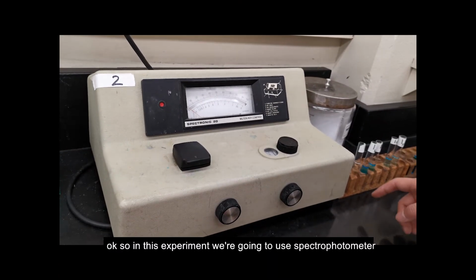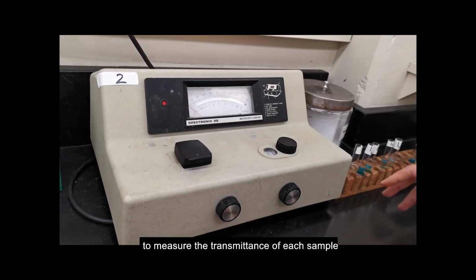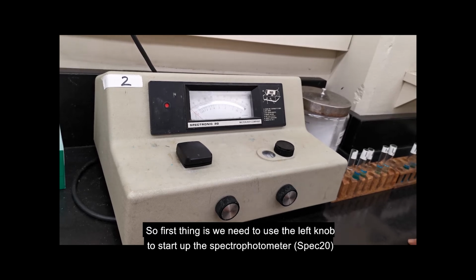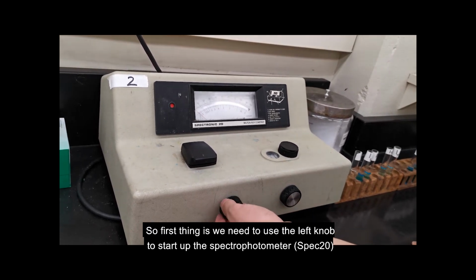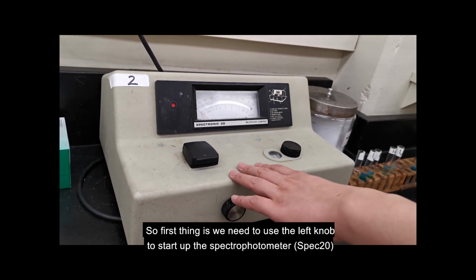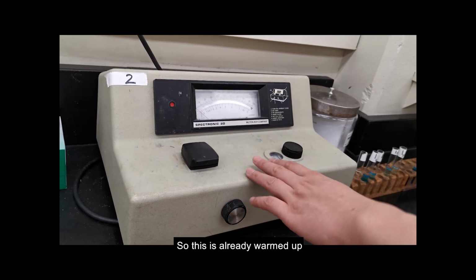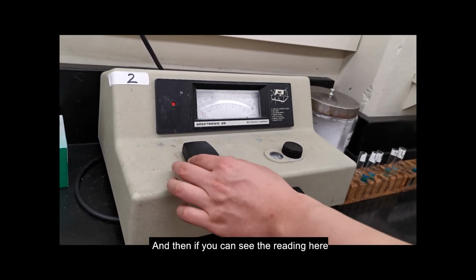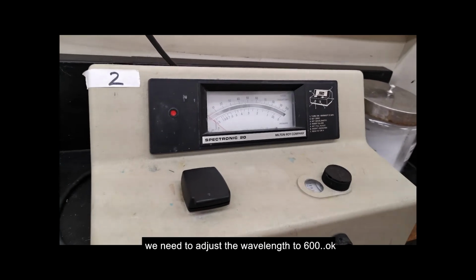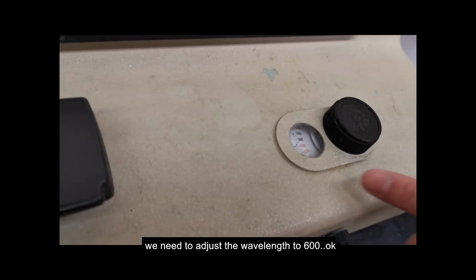Okay, so in this experiment, we are going to use a spectrophotometer to measure the transmittance of each sample. First thing is we need to use the left knob to start up the spectrophotometer and let it warm up for 15 minutes. So this is already warmed up. And then if you can see the reading here, we need to adjust the wavelength to 600.